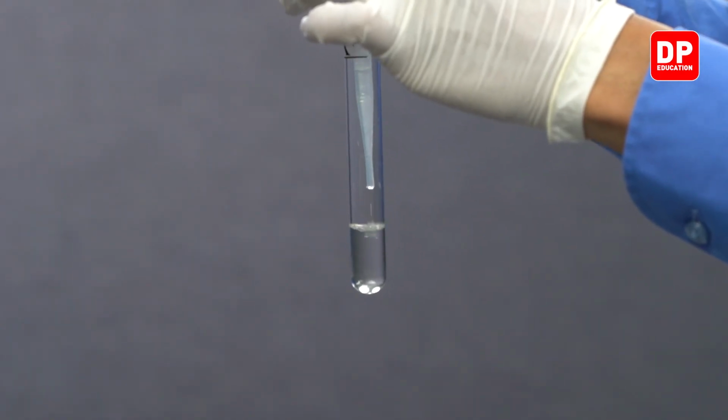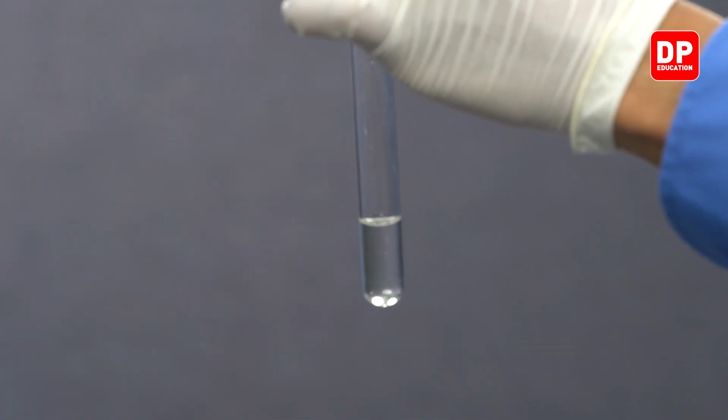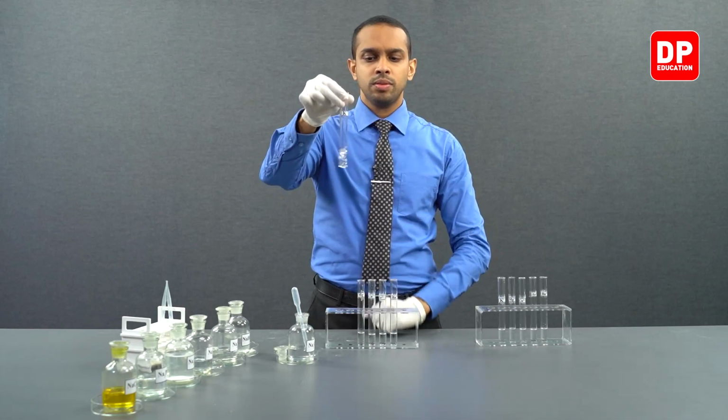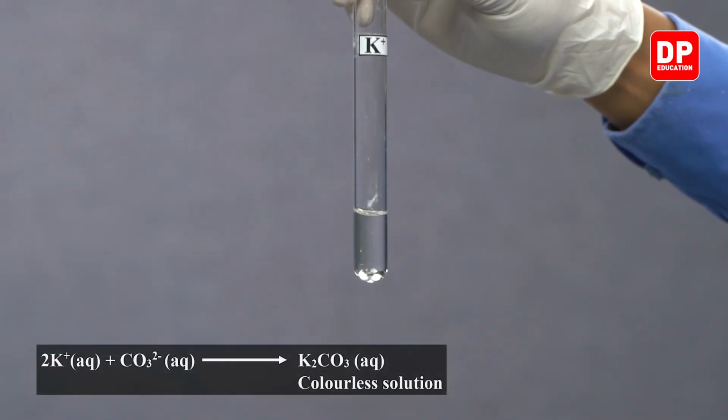Now we are adding sodium carbonate to potassium 1 plus ion solution. As you can see, there is no precipitate formed.